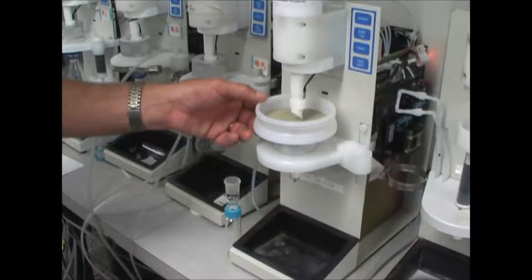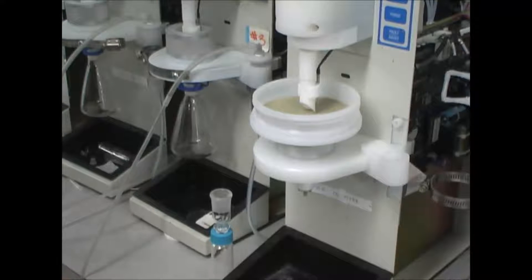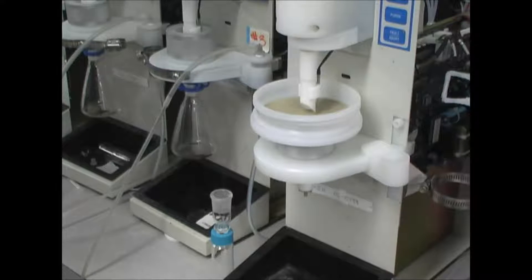Now we can see the water being pulled through, the surface is dry. So that's twelve minutes, forty-five seconds to filter a one liter sample with high suspended material.